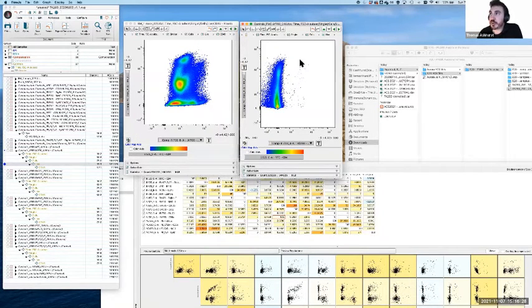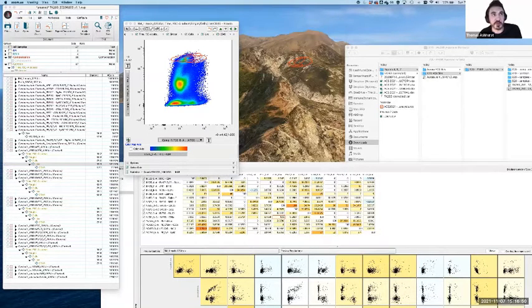If this showed a population sort of out here on the edge, if I'm just going to draw it in red, if we saw it sitting out here as these populations were leaning over, we would actually get a pretty good indication that this is undercompensation. But if we didn't have an FMO present, if this sample is just not here, then how do we know for sure? And the answer is we can't actually know for sure.